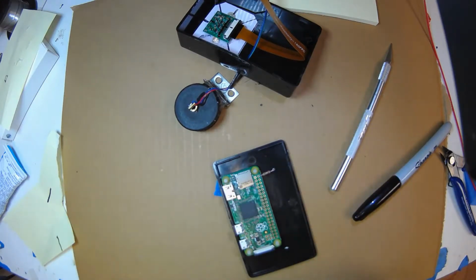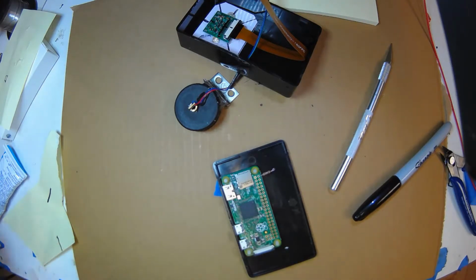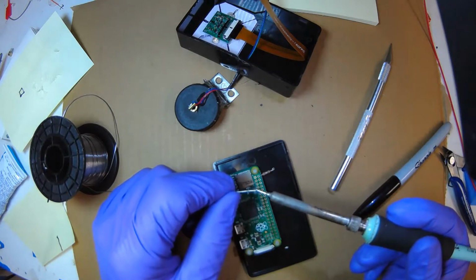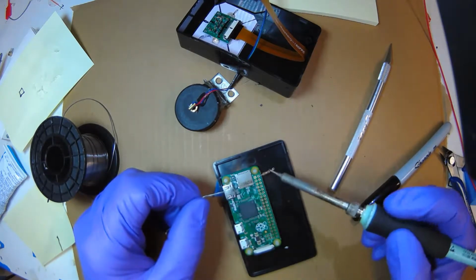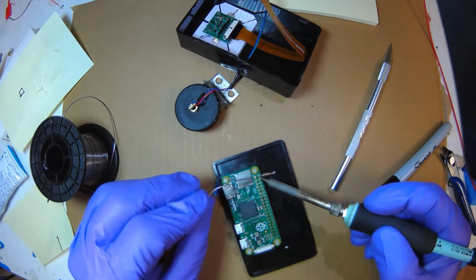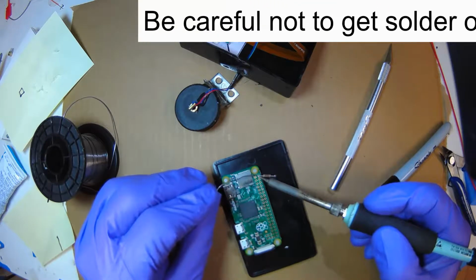The reason I'm doing that is, see, this can drop right down there, and I can solder that. Okay, so you take your soldering iron, I clean the tip, I put a little solder on to wet it, then I put the wet part right on the circuit board. I hold it there, let the joint get hot, then feed solder onto that.